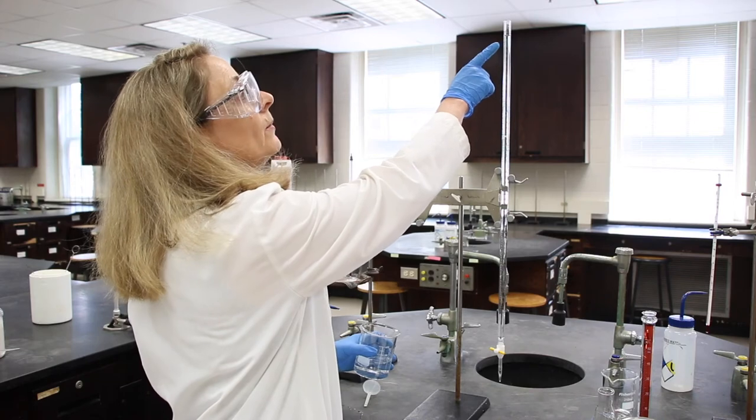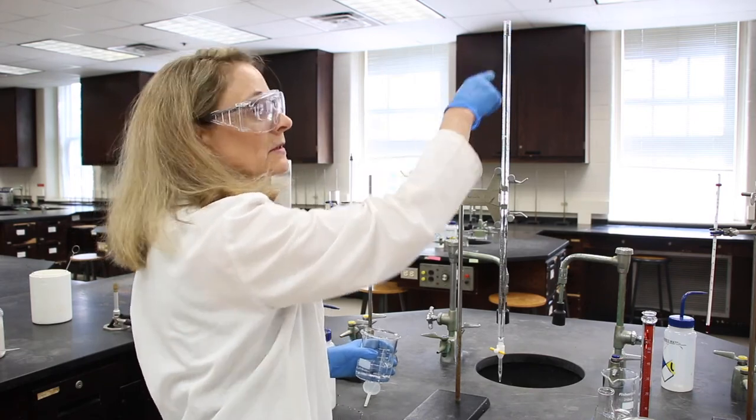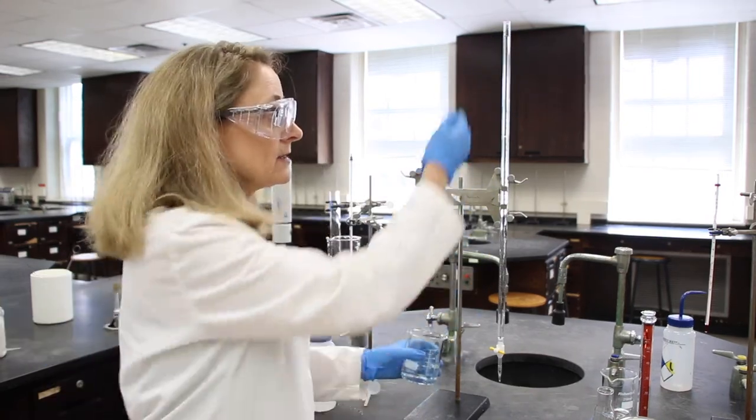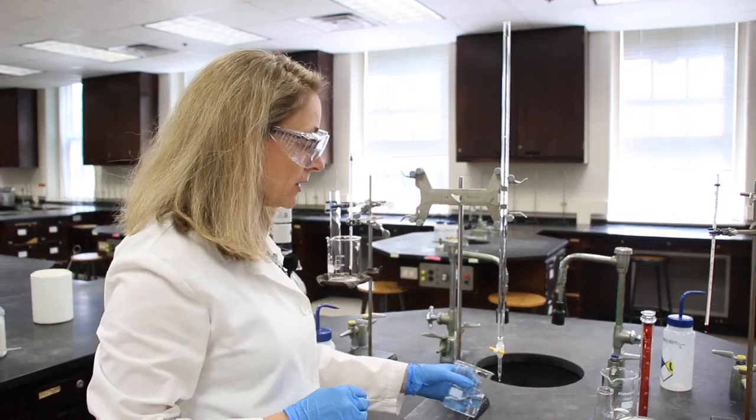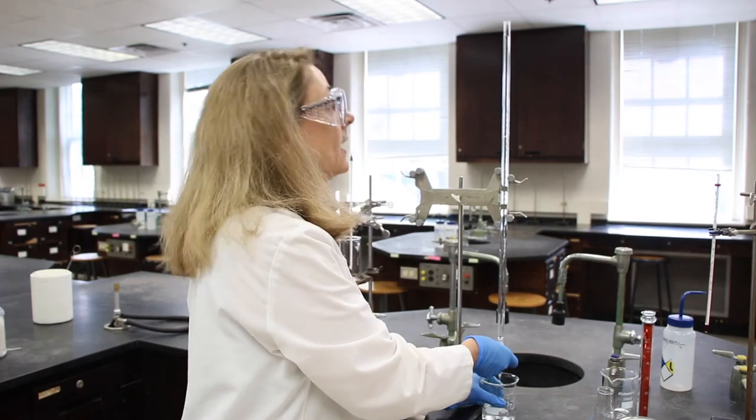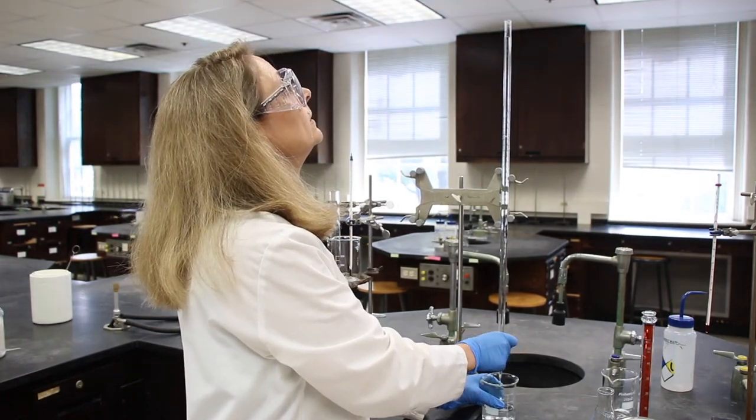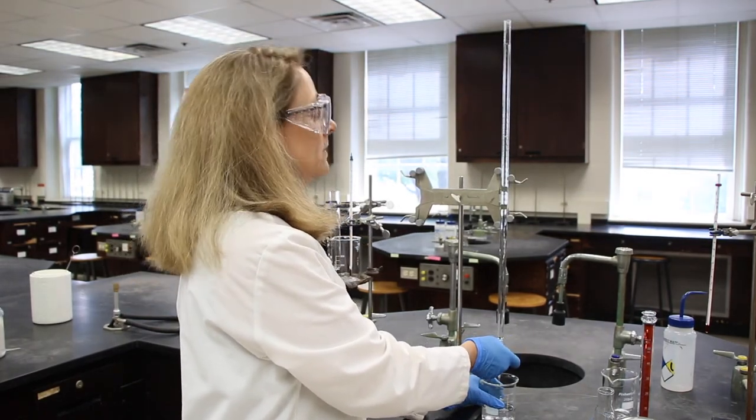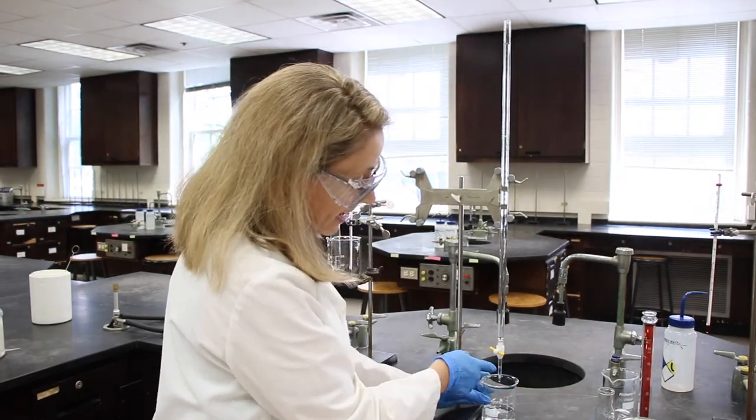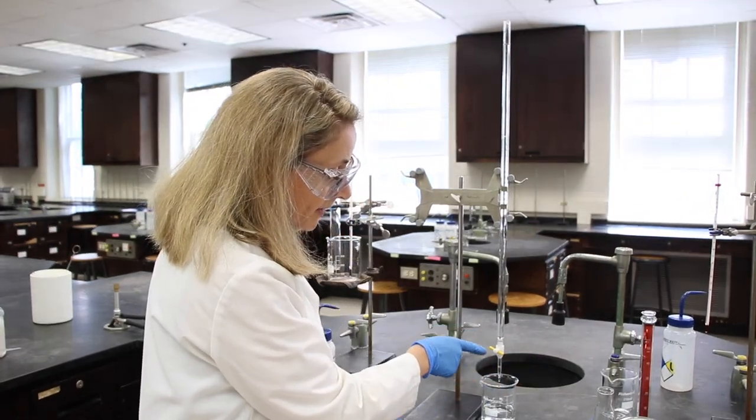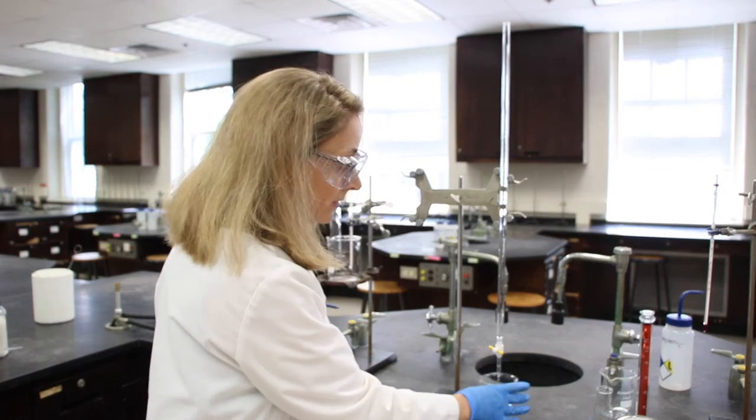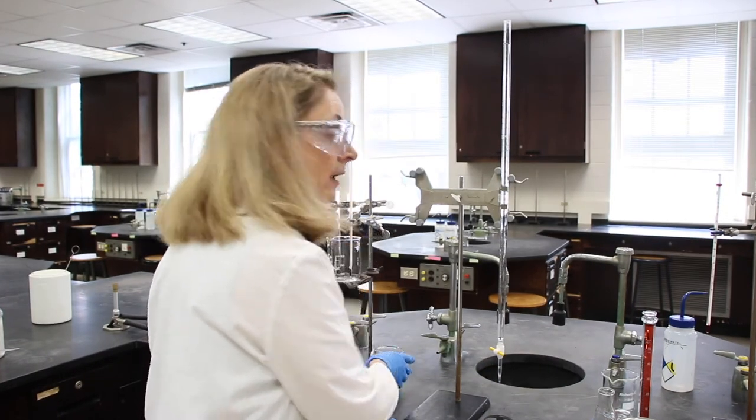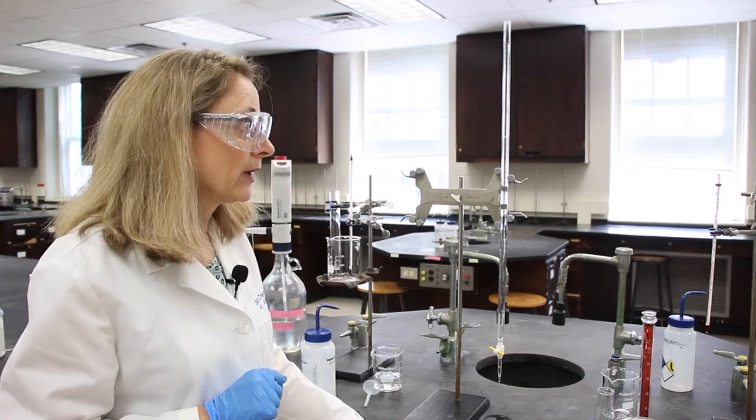Next, I'll bring the meniscus between the zero and the one, actually it doesn't matter where you bring it to just as long as it's below the zero. And by doing so, I have the stopcock and the tip coated again with our solution. Now let's read this burette.